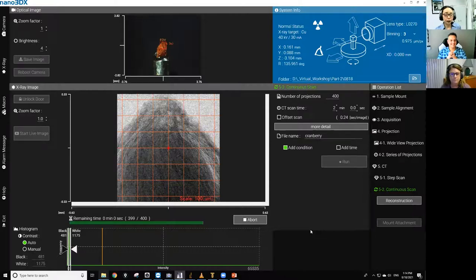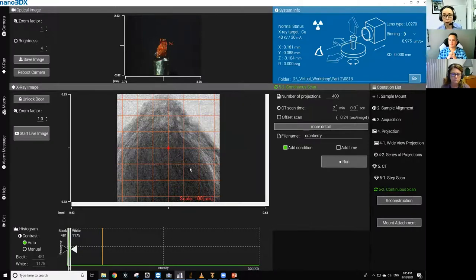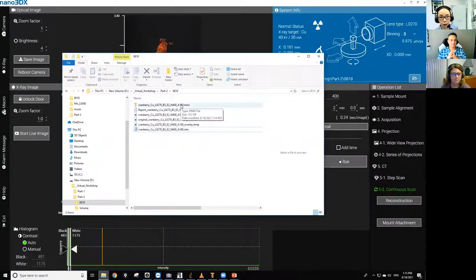So it essentially comes down to the voxel resolution that you need to see whatever feature or details you're trying to image. If you need, for example, a quarter micron voxel resolution, you have to stick with a 20x lens, because even with binning one, that's the voxel resolution you have, a quarter micron. But if you need only, let's say, half a micron resolution, then you can change the lens to 10x and do a binning one scan, which will give you about half a micron voxel size. But you're doubling the field of view by changing the lens. So if you can afford to use a little bit larger voxel size, you can change the lens to cover a larger field of view in one shot. I hope that answers the question. We will have more time to address questions when we do more scans.